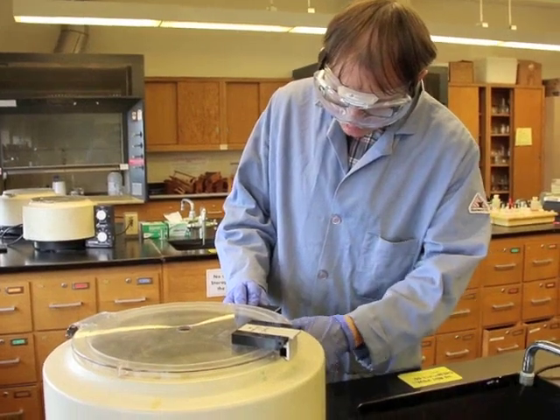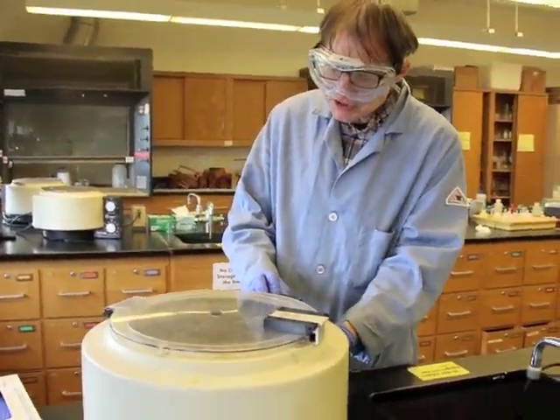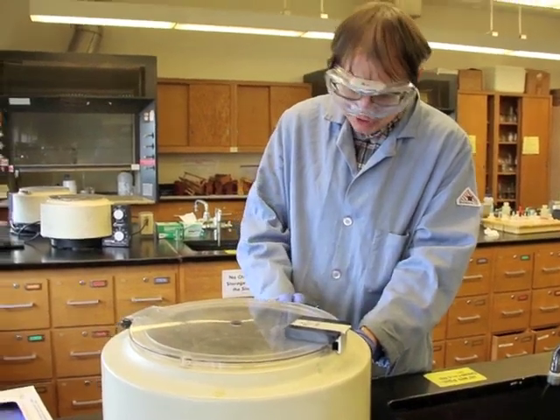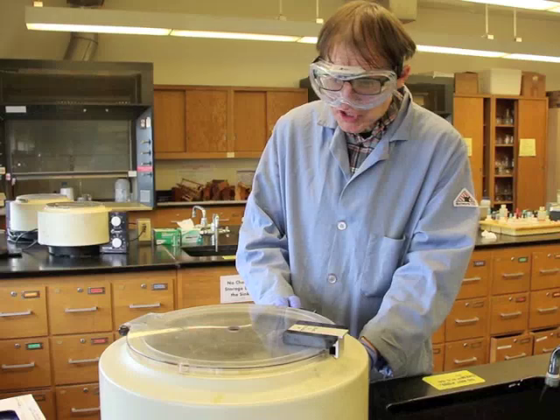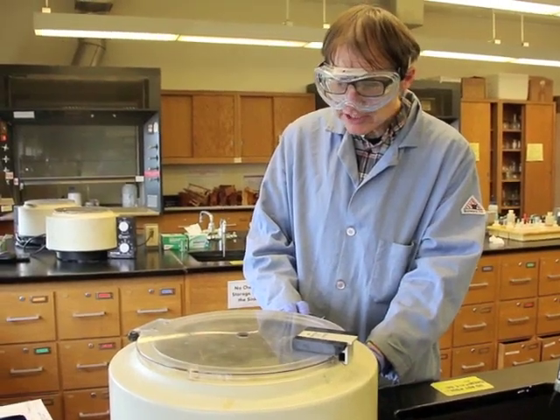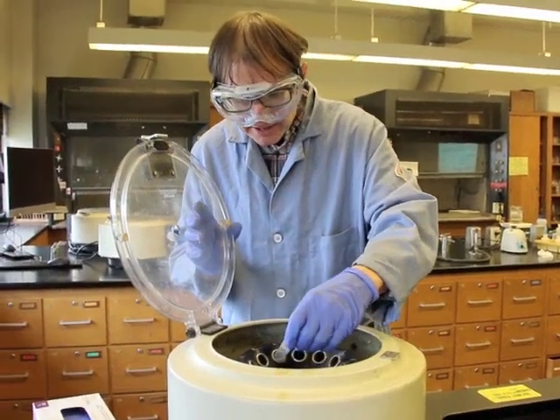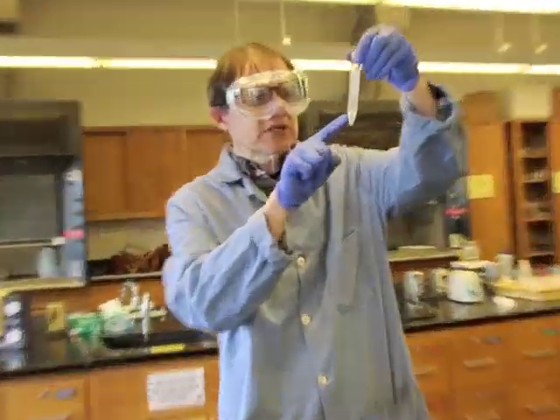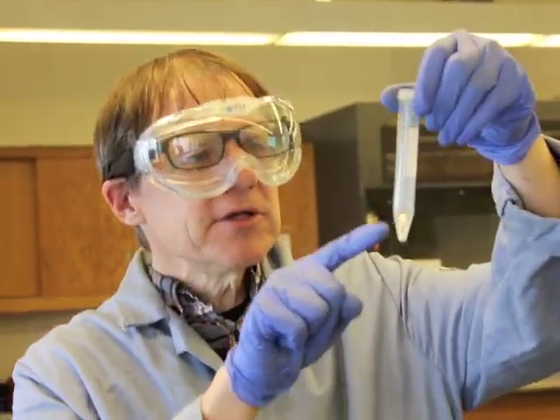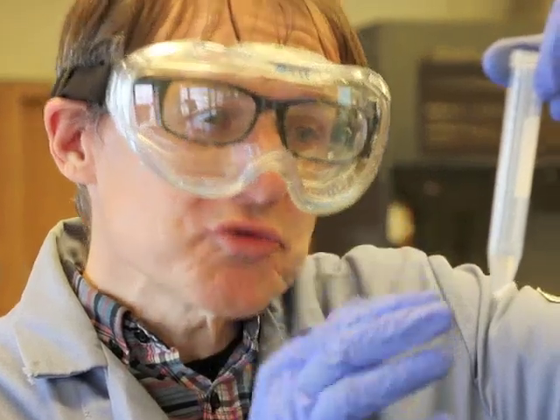All right, so now we're going to stop this one. Again, we're doing the unknown now, so we're going to see what this solution looks like. We're rinsing the solution to see if there's any copper or silver, and if there is, those two ions will go into the supernatant, and we'll be able just to rinse those off and not have to worry about them. Take a look. Looks pretty clean. I don't see any blue in there, so it looks like it's pretty clean, but the silver ion doesn't really have any color, so we wouldn't be able to tell.